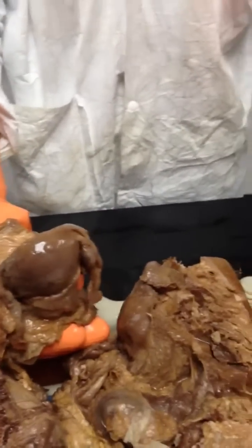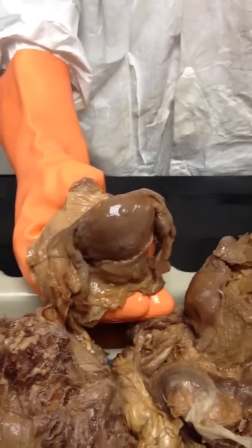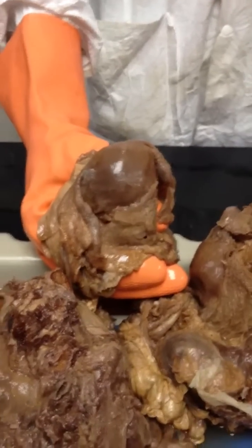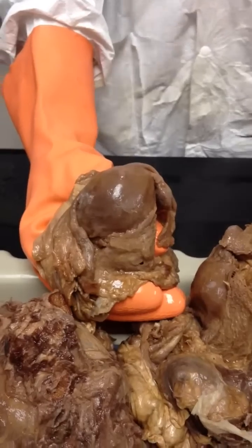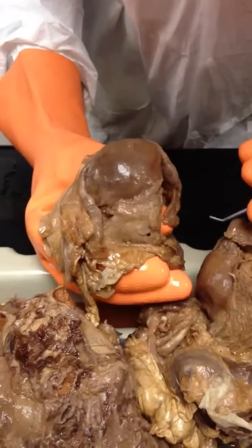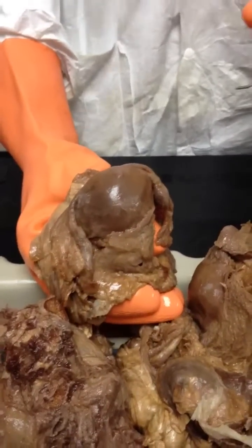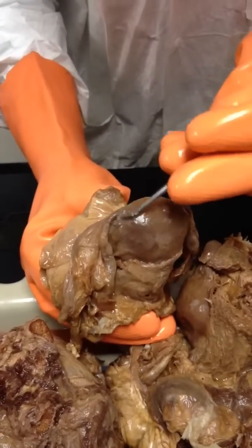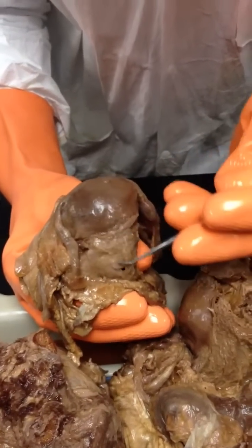It's the same term used for a convex bulge on the stomach just to the left of the esophagus, the fundus of the stomach. And the stomach also has a body, but the stomach doesn't have a cervix, and the uterus doesn't have a pyloric region. Okay, now there was a growth, but I'm not exploring that because I want to keep this one intact. Okay, so it's fundus, this dome-shaped part, body, and cervix.